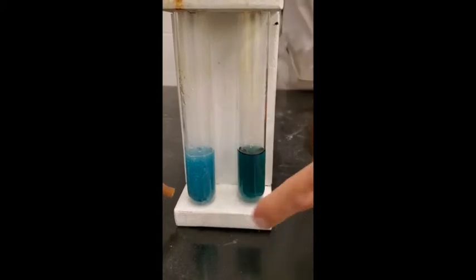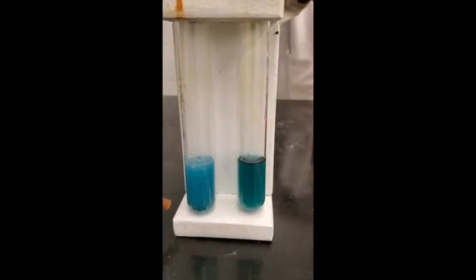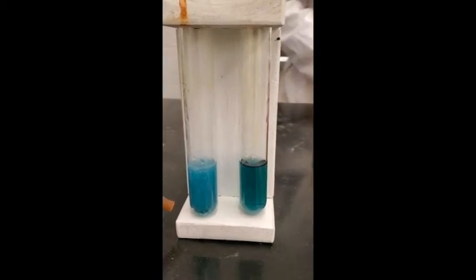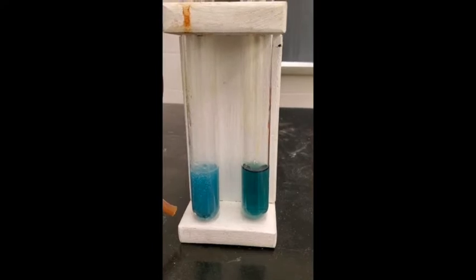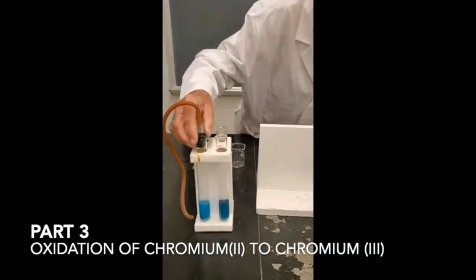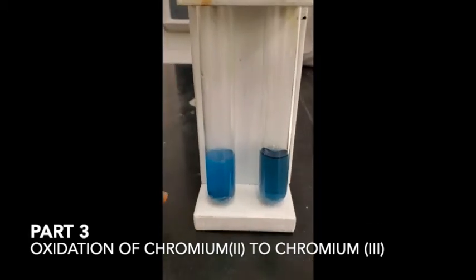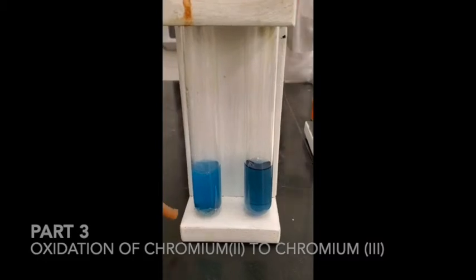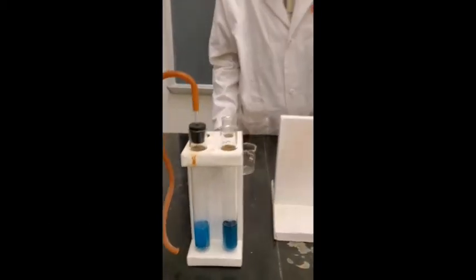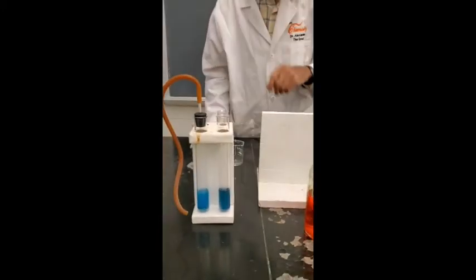You can see that's bluer than that now. It's getting blue. So let's let it go a little bit longer, and then we'll do another experiment with the chromium 2, which is the sky blue color. It's pretty blue now, isn't it? This is essentially completely reduced now. See, it's nice and blue. And this is chromium 3, which is green under these conditions. And then remember, this is the dichromate. +6, +3, +2 oxidation state.